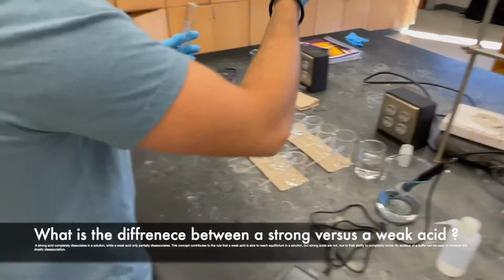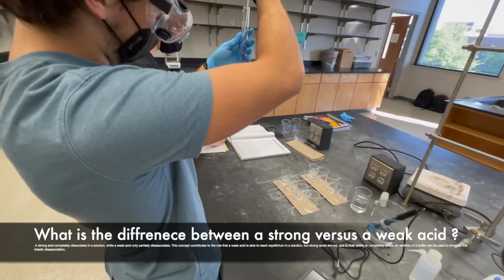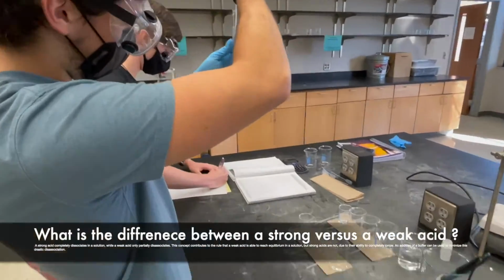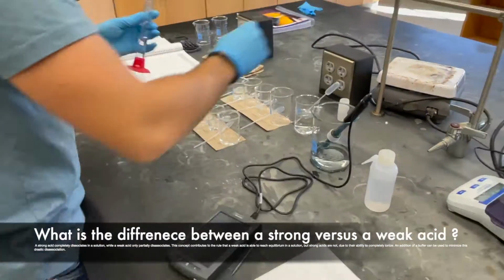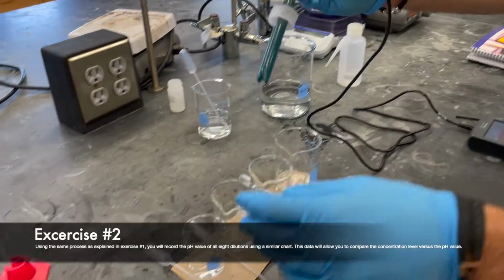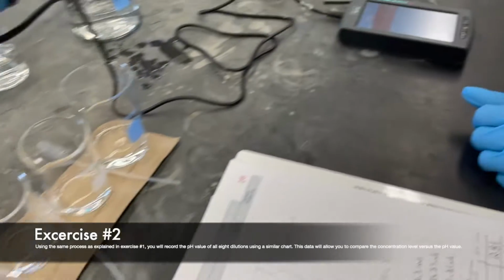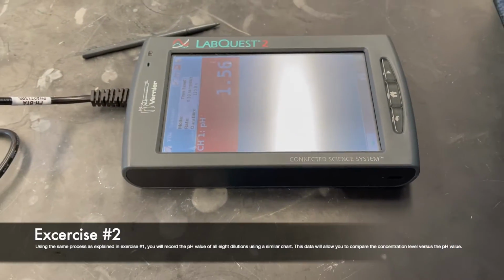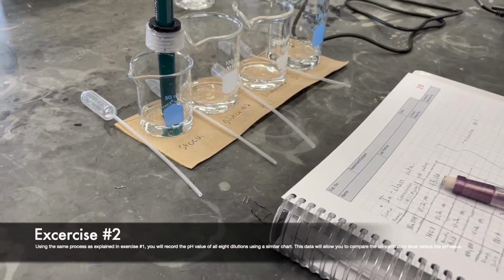The main difference between a strong and weak acid is its ability to fully or partially dissociate in water. A strong acid will fully dissociate, while a weak acid will only partially dissociate in water. Again, record and compare the pH values of the diluted solutions to their corresponding concentrations. The data recorded from this experiment will allow you to create a scatter plot diagram that illustrates a relationship between concentration and pH of that solution.